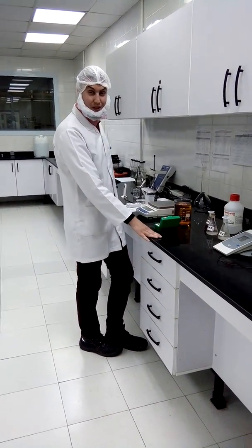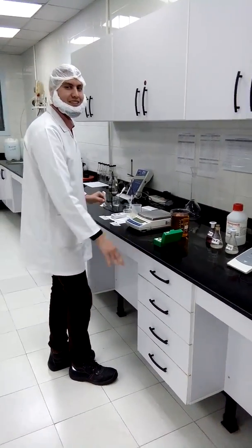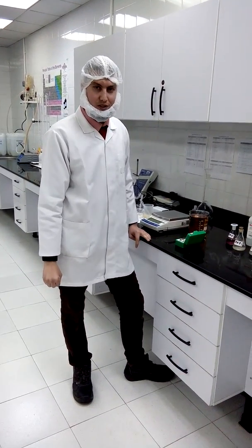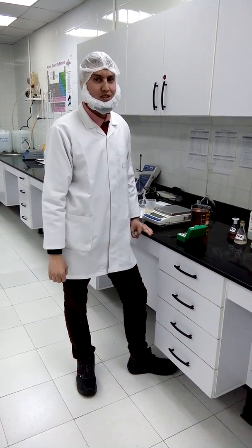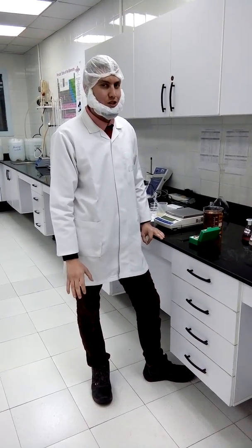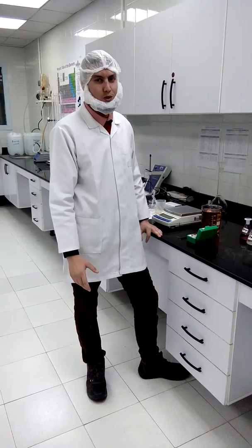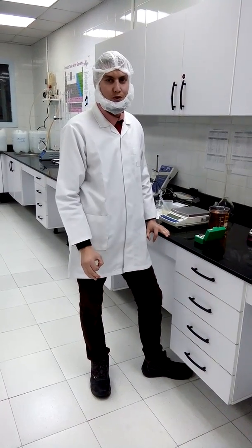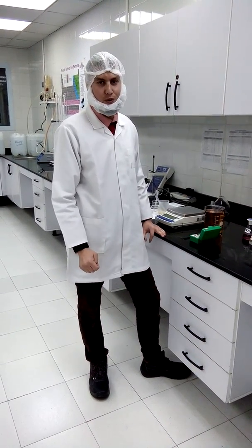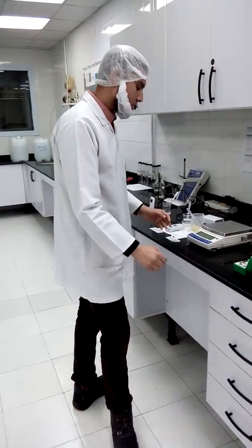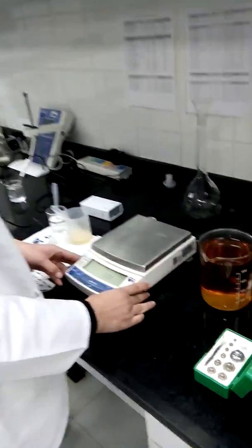Welcome. Today we will be talking about acidity determination in juices, which refers to the most organic acid in juice, which is citric acid. As we know, the equivalent weight for citric acid is 64. Now we have to make sure our balance is ready.